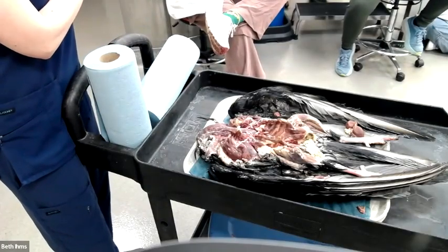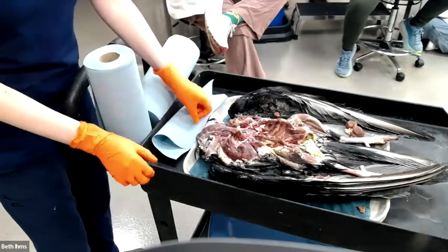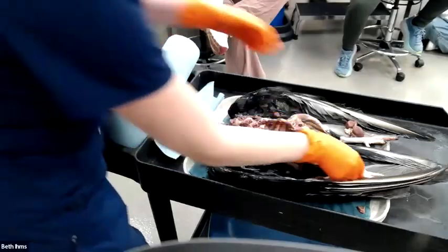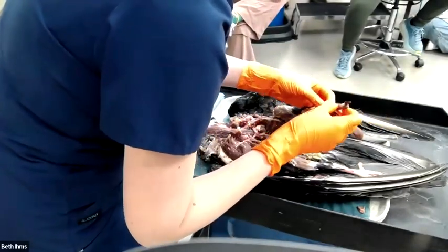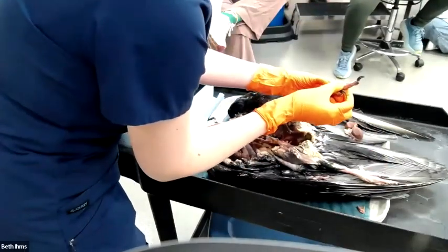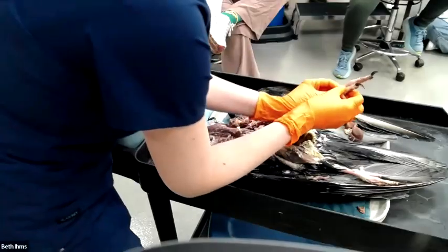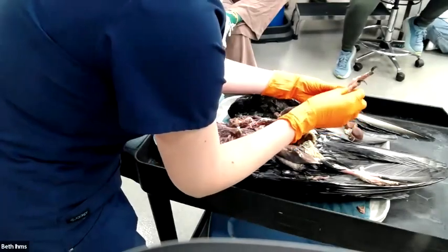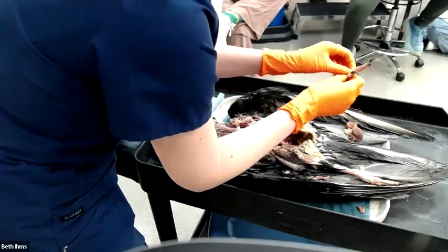All right, questions about this guy, gout. Can we see anything, just from this one in particular, from his toes? Not really. It looks like they didn't really open any joints. He does have, on this foot with the amputation, one toe that's starting to get pretty discolored. Usually with articular gout, you'd be able to palpate that his joints are swollen. I can't really feel that they're swollen.